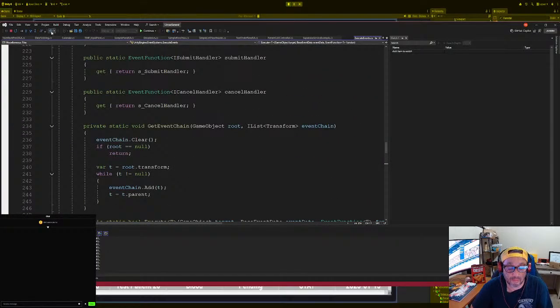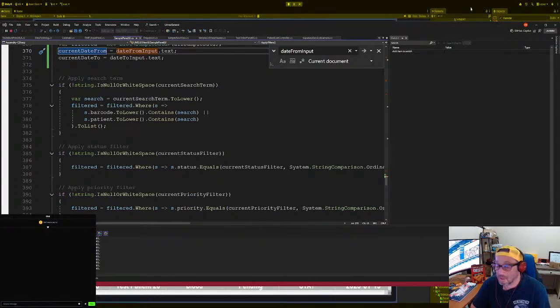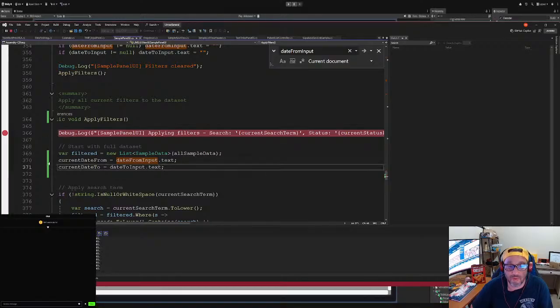I know why it's getting a date. It's not text. It's not text. Why did I get an exception? Okay, let me see. Okay, let's do it again one more time. Okay, what? Oh, it's null. That's why. Okay. So oftentimes you say if blah blah blah is null, then it's not null. Then you do this. So we forgot to assign the stuff here. Okay, so this is for the scroll view. And yep, and we didn't assign the thing here, right here, right? And then while we add it, we might as well just add it here.